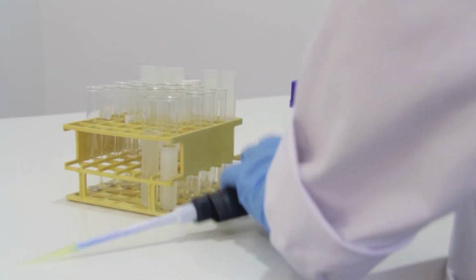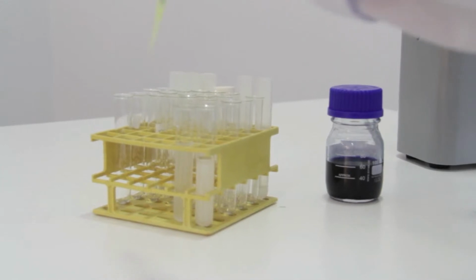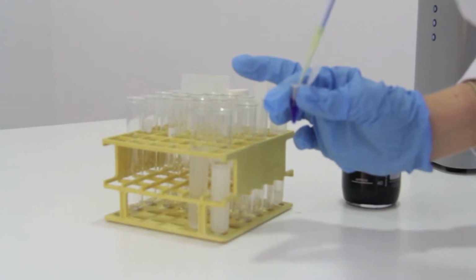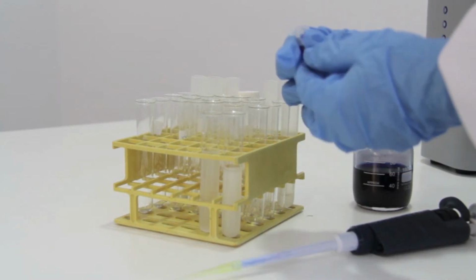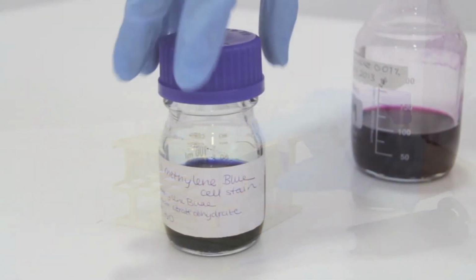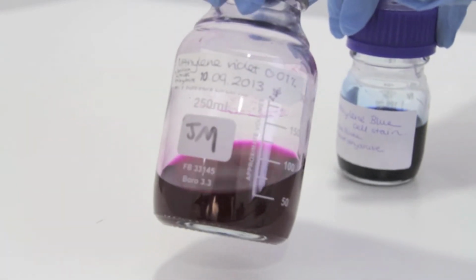The CountStar uses classic cell stains such as methylene blue or methylene violet to assess viability of yeast populations. Live cells appear colourless, whereas dead cells take up the stain. The digital image technology can pick up on this to produce a percent mortality of the sample in a matter of seconds. Methylene blue and methylene violet are much safer to work with than some of the fluorescent dyes used by other automated cell counters.